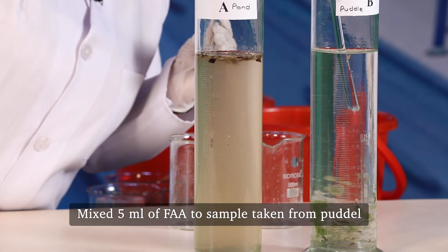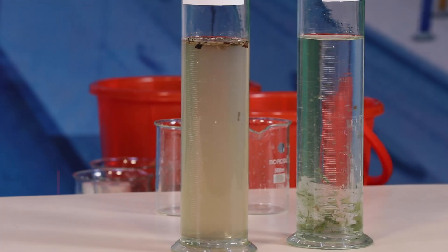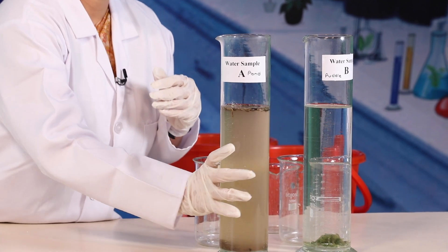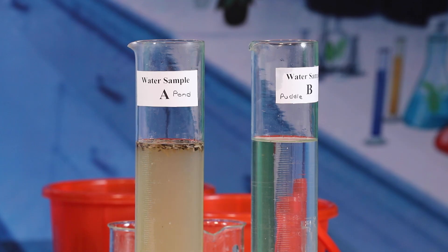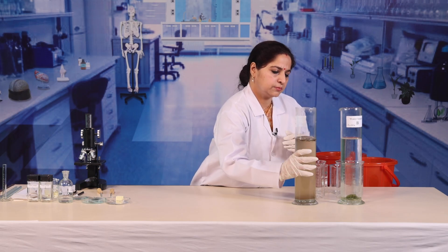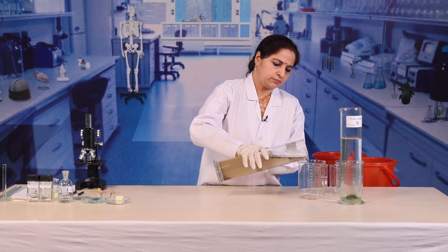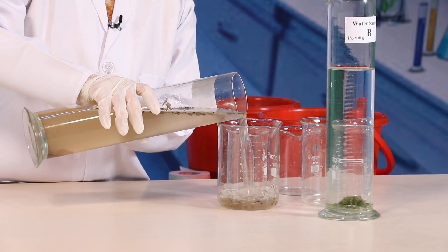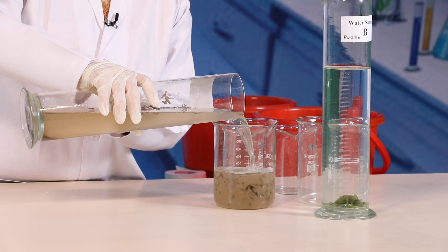Now we will leave the samples undisturbed for 48 to 72 hours. After 2 to 3 days, you will observe a concentrated sediment at the bottom with clear water above. Decant off the clear water, leaving the sediment at the bottom.